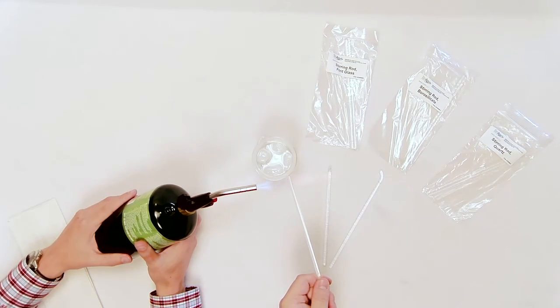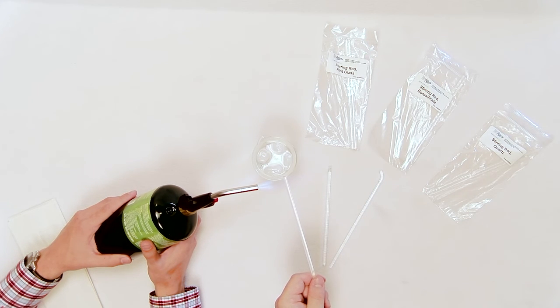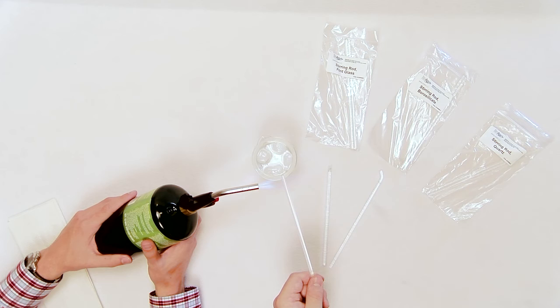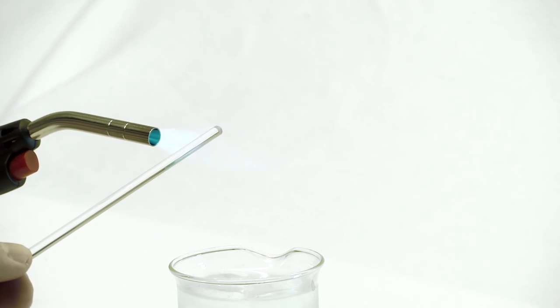Heat one end of the fused silica glass rod in the flame in the same manner as the two previous rods. There should be no sodium flare and no sagging, slumping, or fire polishing.